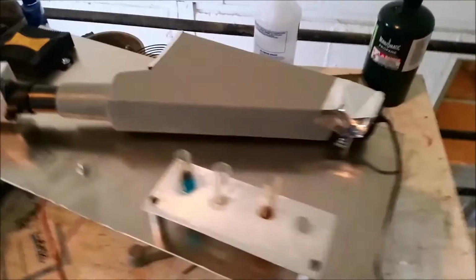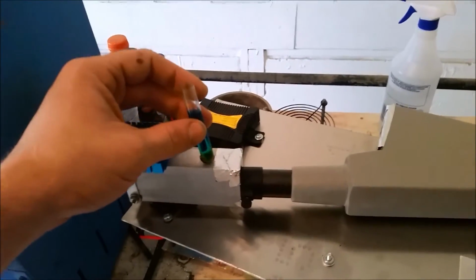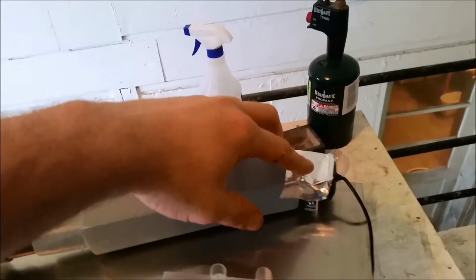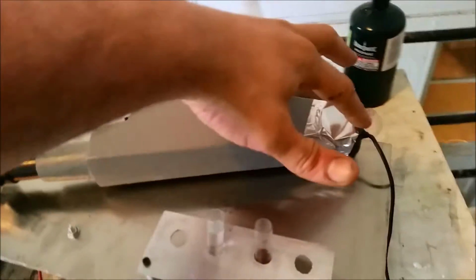Hey guys, so I'm going to give an update on this spectrometer that I've been working on. I finally got it for the most part done. It lights up a sample. How it works is you just drop that in here, and the light passes through the sample, comes through the slit here, and then eventually hits the diffraction grating, and then is picked up by the camera.